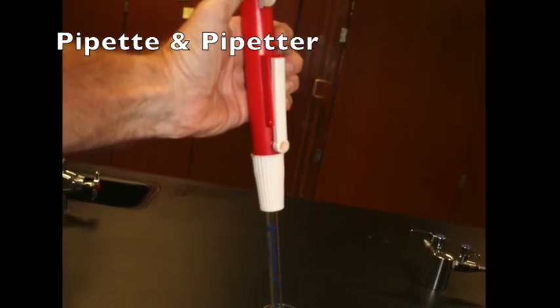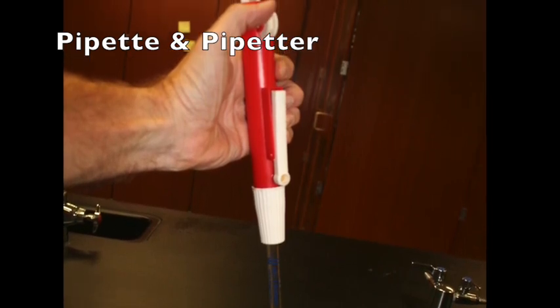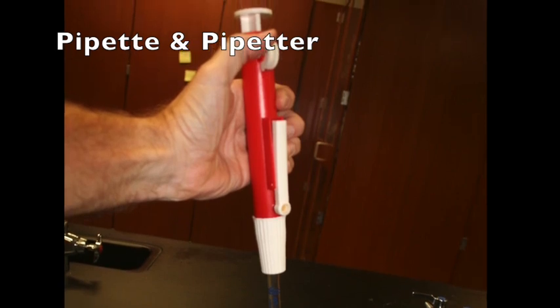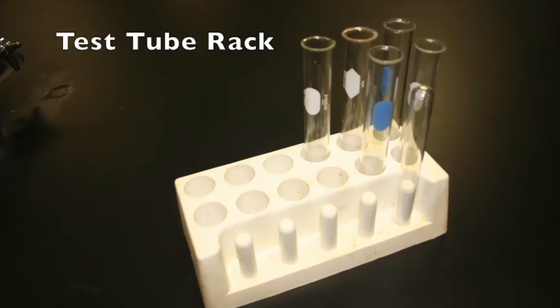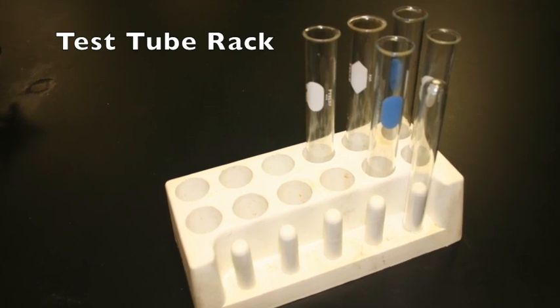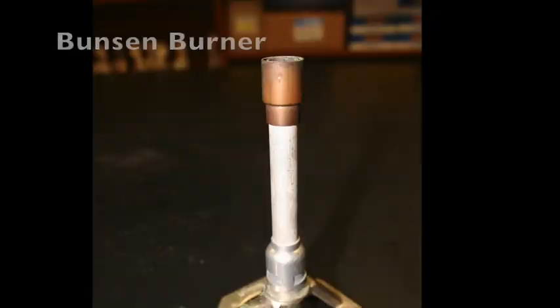The white wheel on the side of the pipetter is turned up in order to draw in the liquid and spun down to expel it. The plunger at the top and the long white lever on the side are also used for rapid release of the liquid. The test tube rack has appropriately sized holes to hold test tubes in an upright position. Test tubes can also be cleaned and turned upside down to allow them to dry.